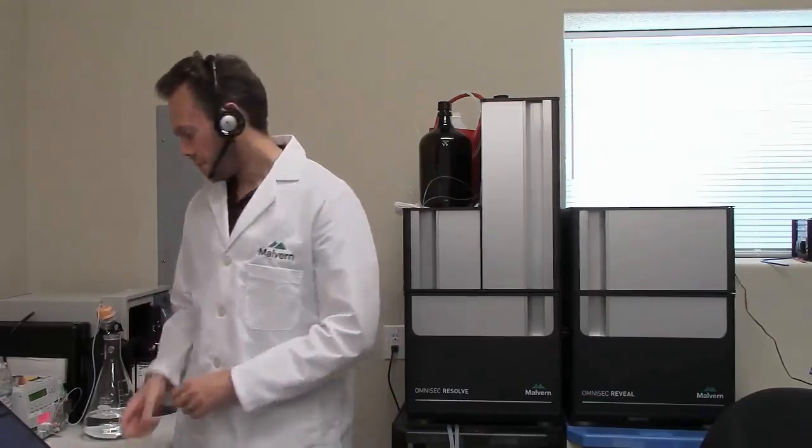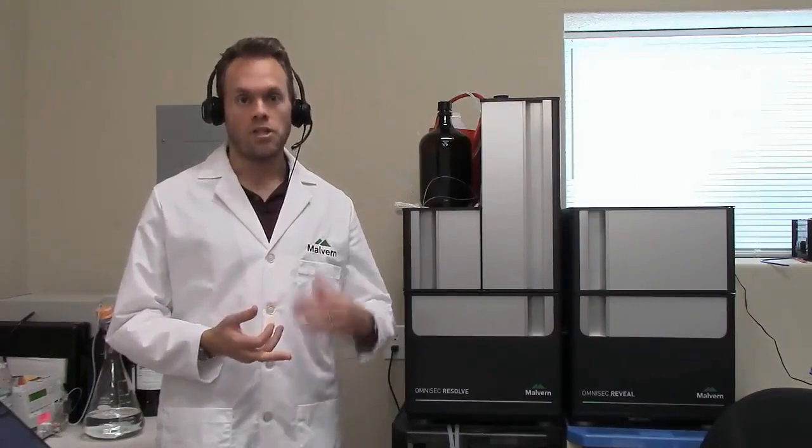And the second danger is the big viscosity difference between the first and the second mobile phase, so the water and the THF. And we saw in the viscometer that there was a huge change, a huge DP signal when that THF came through, even when I was running at 0.5 mils per minute. So I purged the DP. If the viscometer goes up to 5,000, purge the DP immediately. Turn the flow rate down, give it a few moments, and then end the purge and see where that goes.